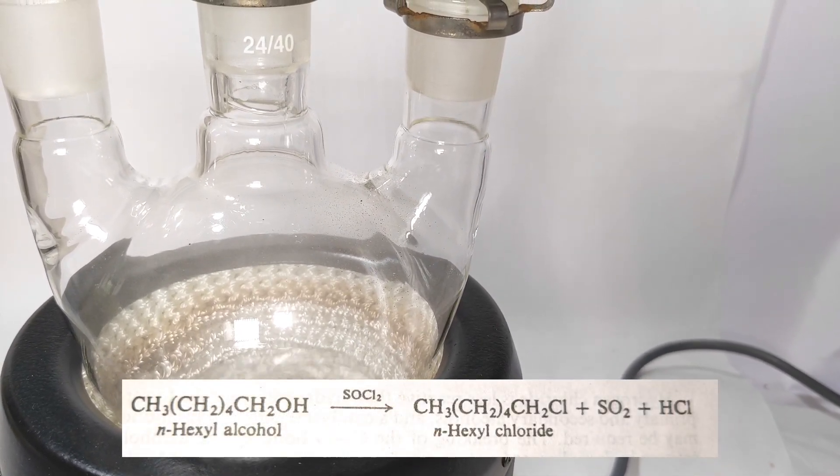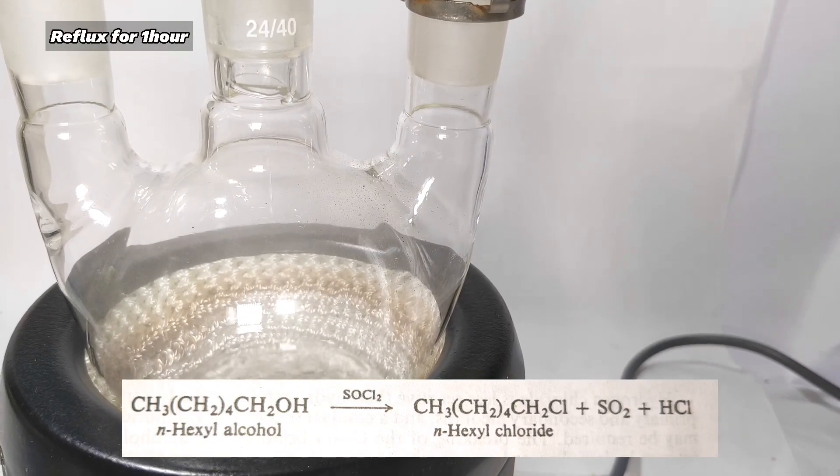Once everything is added, reflux the mixture for 1 hour to let the reaction go into completion.